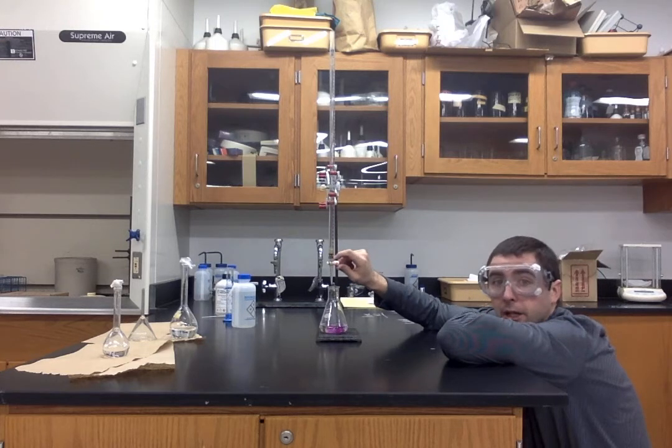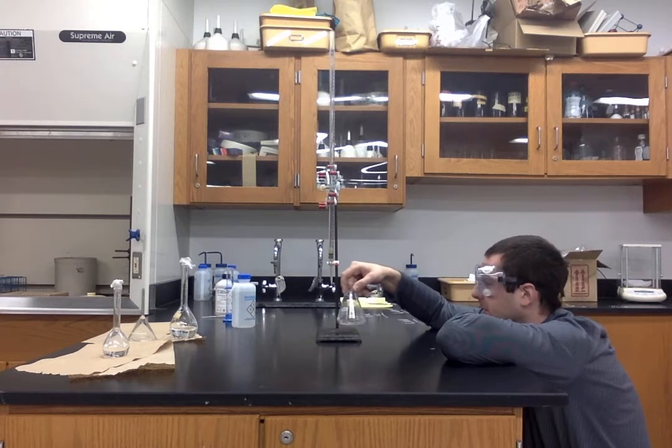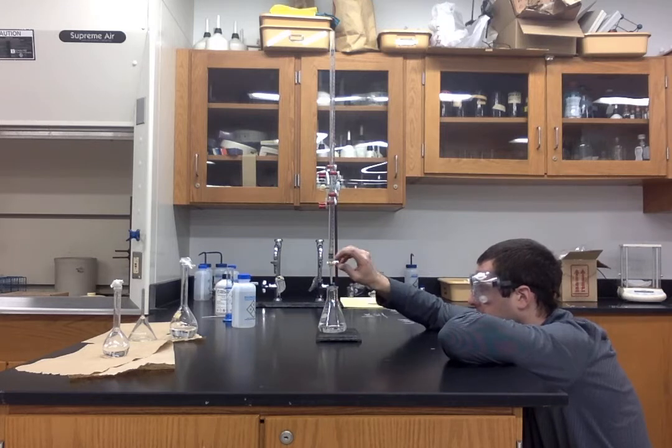If you're still watching at normal speed, feel free to speed this up. Okay, we're getting very, very close. Two drops at a time from here on out.